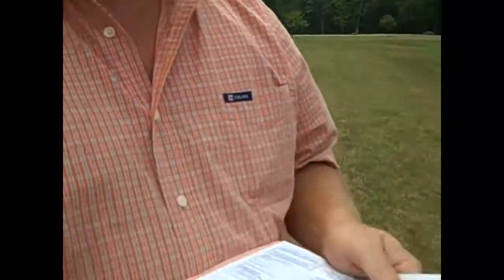Basically, the information you get back from a soil sample will give you the pH of the soil and the nutrient levels in the soil. We will also give you recommendations of how much and what kind of fertilizer and how much lime to put on your soil to grow whatever you're trying to grow. You can't pick up some soil here in North Carolina, smell it, taste it, feel it, and get a good idea of what the pH is or how much fertilizer you need to add. This is the best way to find out that specific information.